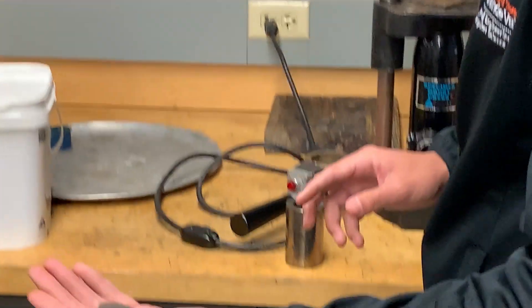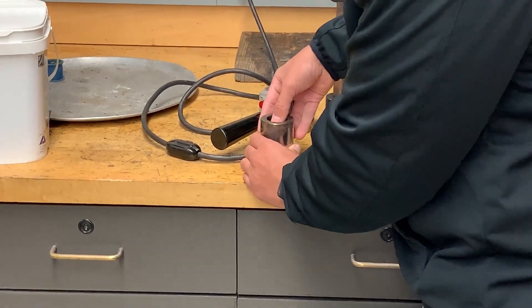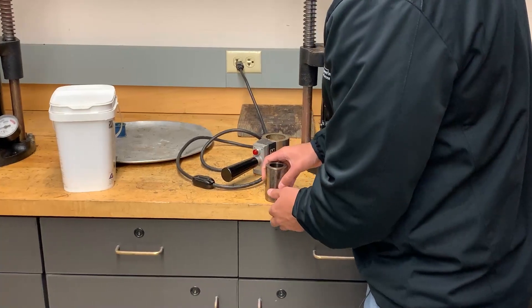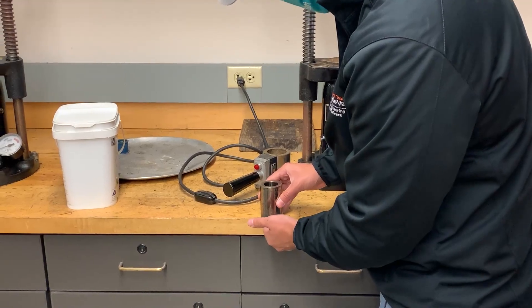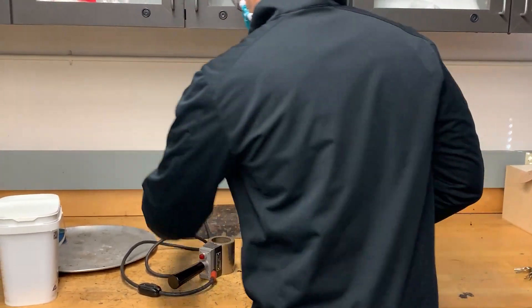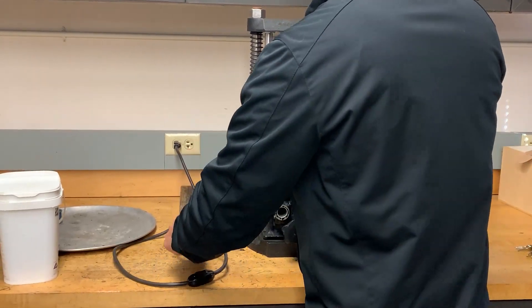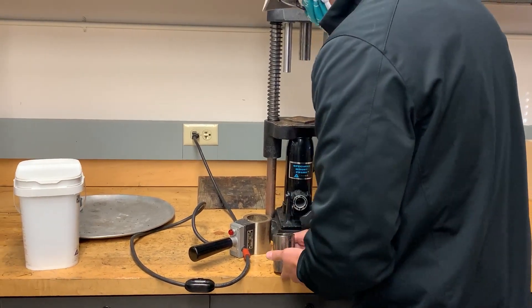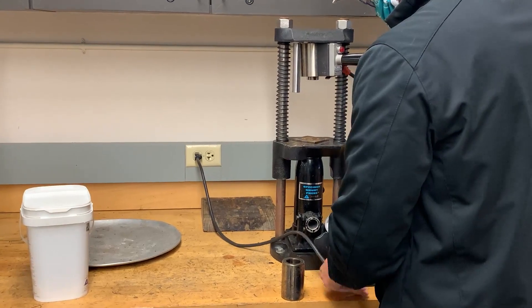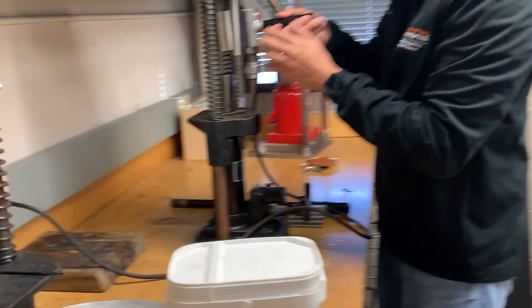I'll return the rest of the resin. I'll place the remaining mold disk onto the top and press it down to compact the resin. I'm going to grab the mold specimen while holding the bottom so the bottom doesn't fall out and the resin and sample don't slide out. I'll place it on the mounting press and plug in the heating element — though I should have placed the heating element in prior. Get the heating element into its location, slide it up into its holding spot, slide the mount back in, and place the heating element over the mold.